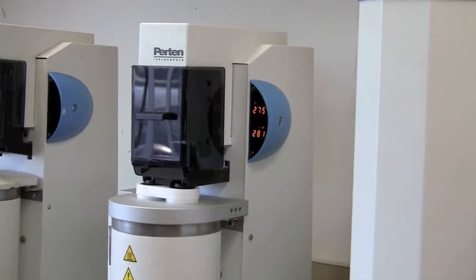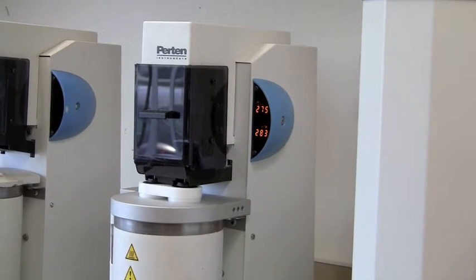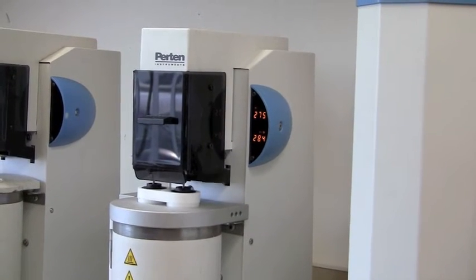The results of these two samples need to be within 5% of each other, or we have to run the sample again.